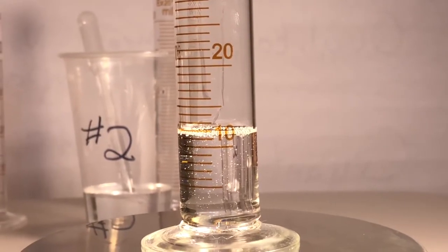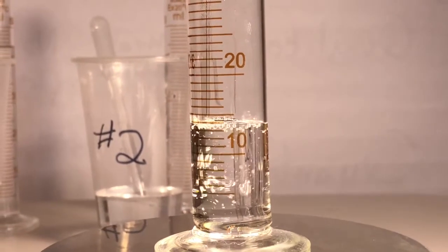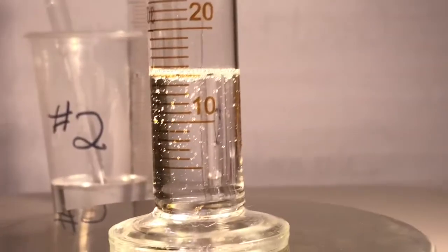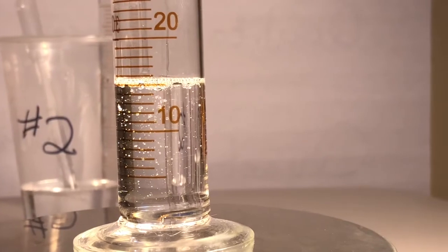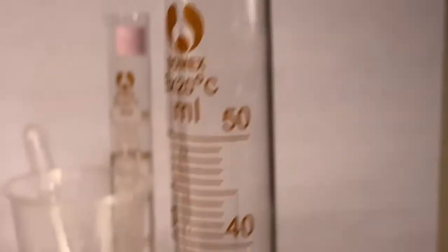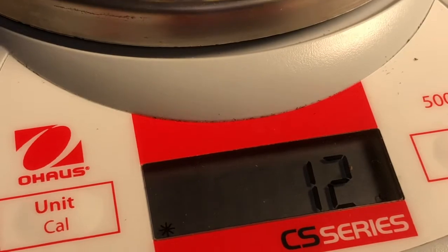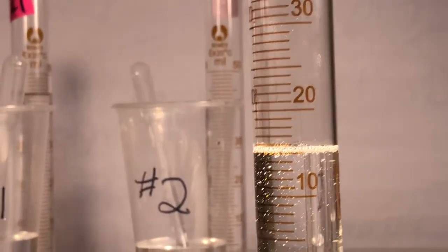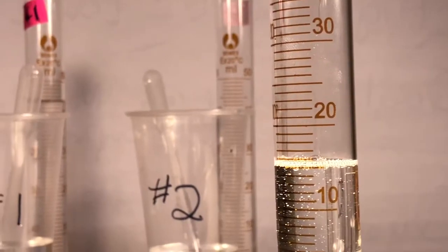Point number 3. Yes. And plooch. Point number 3. Get your eyeball right on there. What's that? Got it. And here comes, oh, other way, dummy. He's got it right there. And here comes number 4.